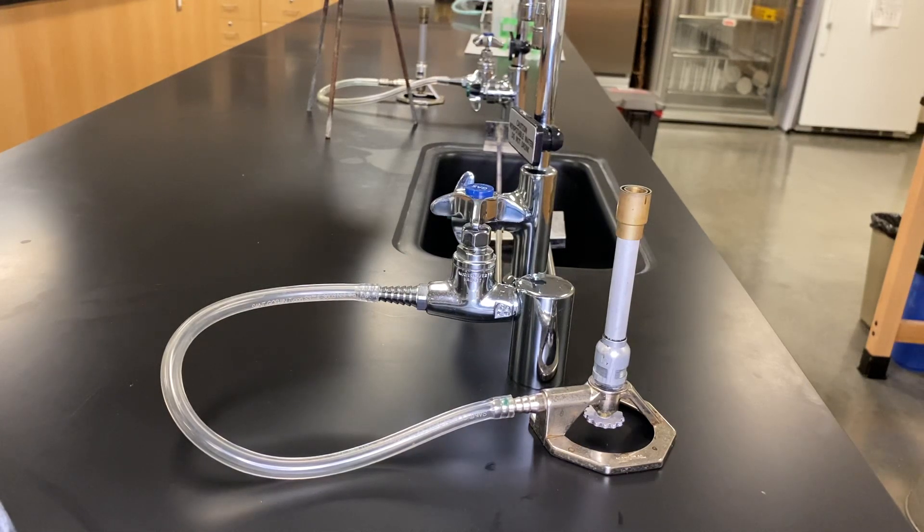So part of your training on how to create sterile environments, preparing plates, and everything else is the use of your Bunsen burner, which is our lab room number four.